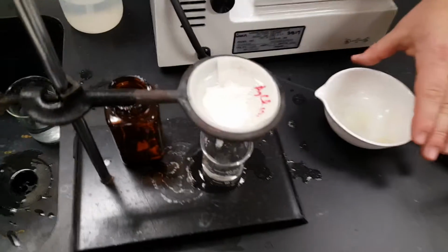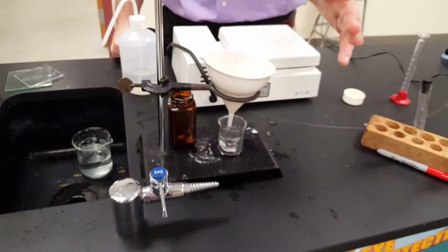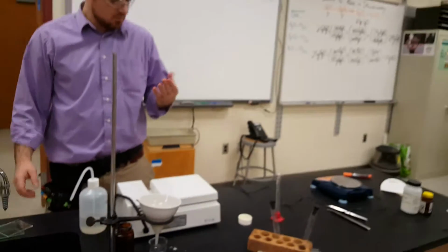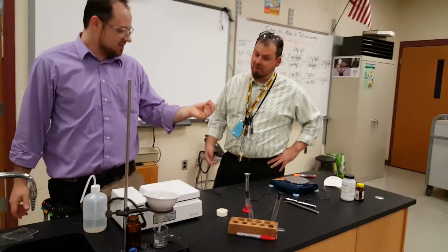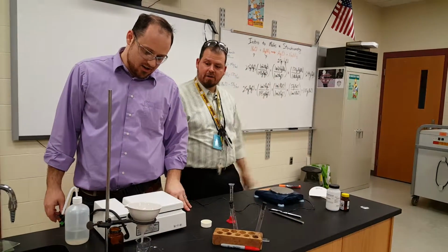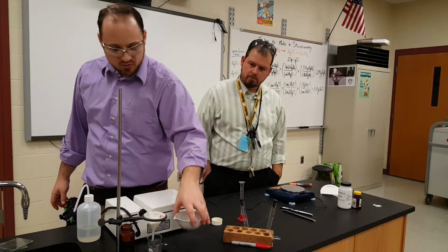So I'm going to put the lid on to keep it from reacting overnight, and we'll have a nice dry white powder in the morning. I actually feel my fingers are nice and slick already. Oh, nice. There's a little bit of a reaction. So tomorrow we'll weigh it and see if the proof's in the pudding. We'll see if our calculations were good, and if our techniques were all right, and we made 2.5 grams of this stuff like we were supposed to.